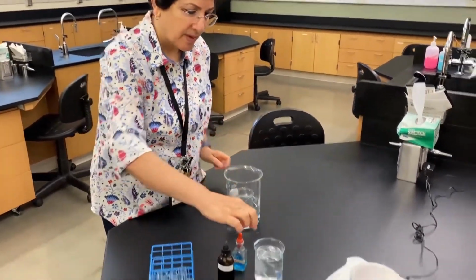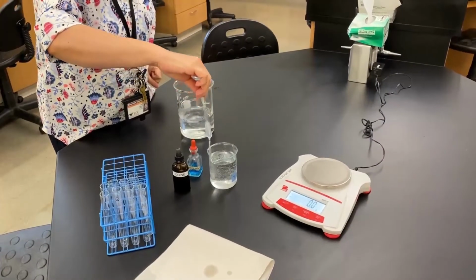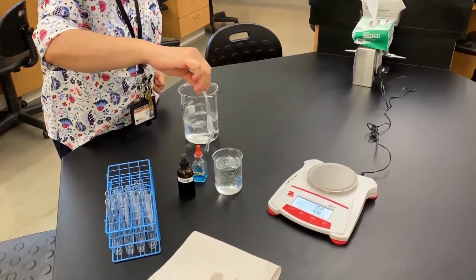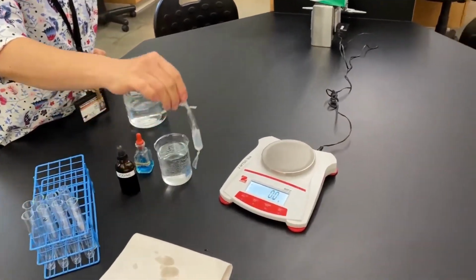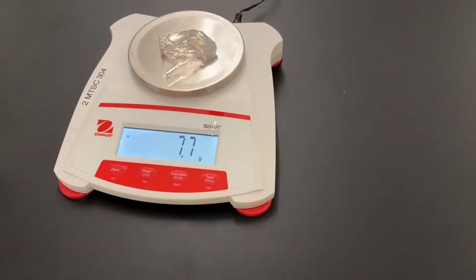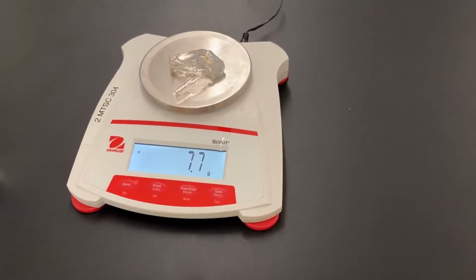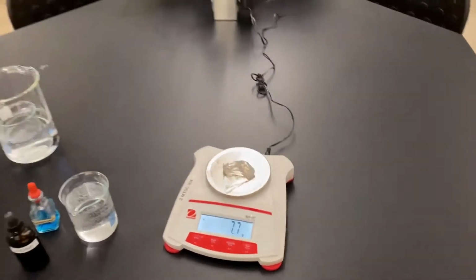Okay, well, 2 hours have passed and now it's time to finish the dialysis experiment. We're gonna take the dialysis tube out. As I said, it's been soaking for a while. We're gonna just remove excess water and we're gonna weigh it and see if there is an increase or decrease in the weight. Okay, so please record this number just as you did before and compare them.